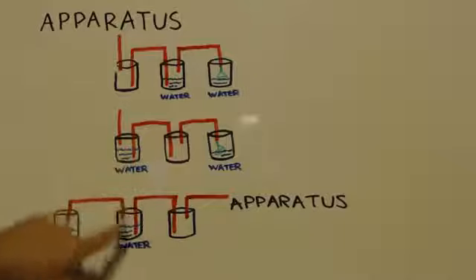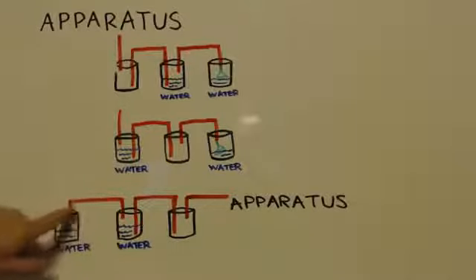See there? Now all you do is take this hose that you had on your apparatus, right? And you connect it to a funnel, move your jar over here with your water, right? This side that was connected to the funnel, you connect to the apparatus, and you're all ready to go. Nothing got sucked back into your experiment. And it's an easy switch around. You just switch your funnel and your hoses and put your canister over here. You're ready to go again.